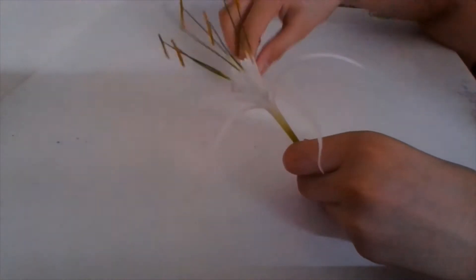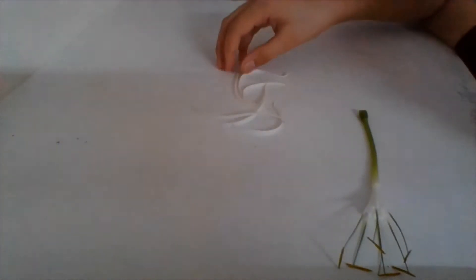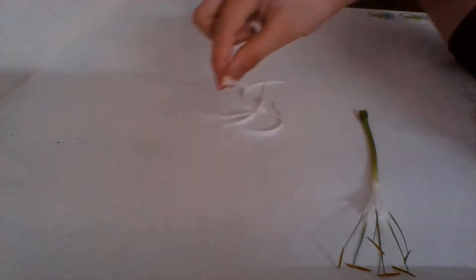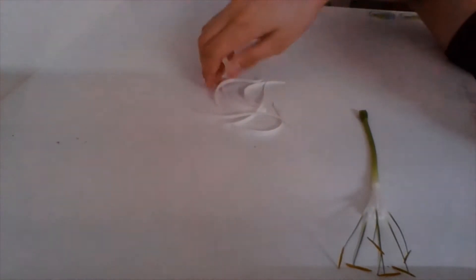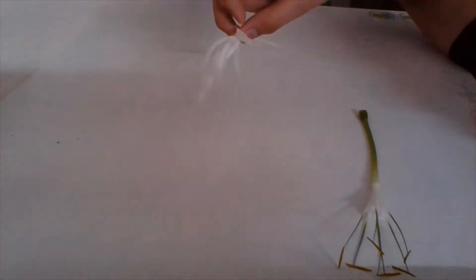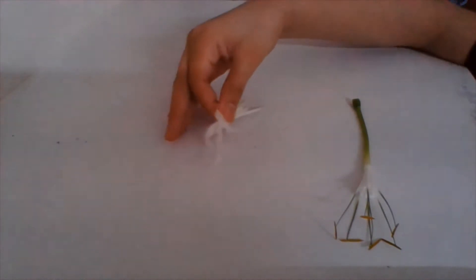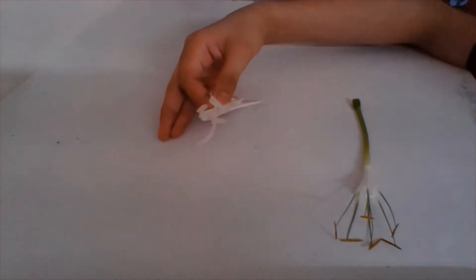One, two, three, four, five, and six — so this is what we are left with. This one is the petal, and all of the petals in the flower together are known as the corolla. These petals are a common part of many, perhaps all, flowers.